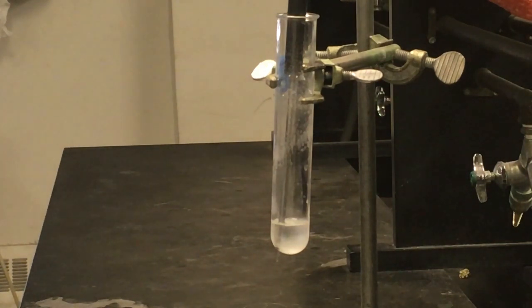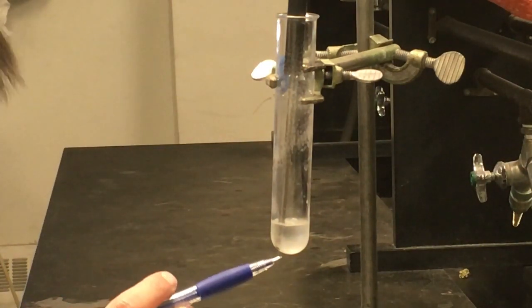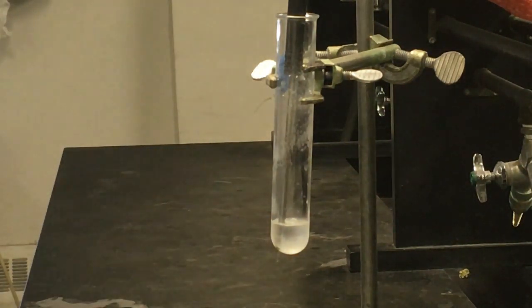So it does look like we are starting to get some crystal formation here. You can start to see it along the bottom, but even some strands going up and down in the solution. So definitely crystal formation here. Temperature was 69.0 degrees. Again, much lower than 79 or 78 where we saw the crystals form for the very first trial. It was pure naphthalene, so that's good.